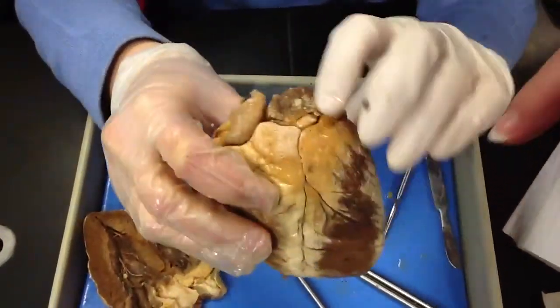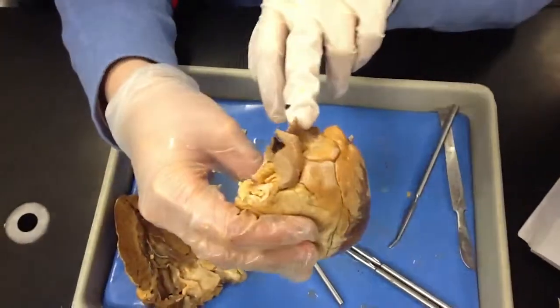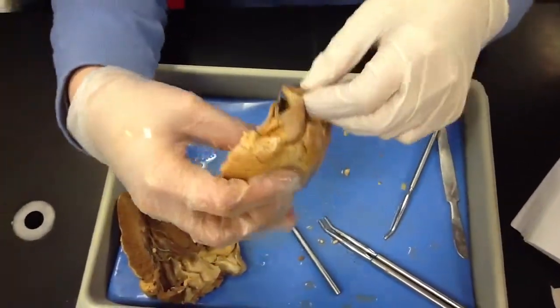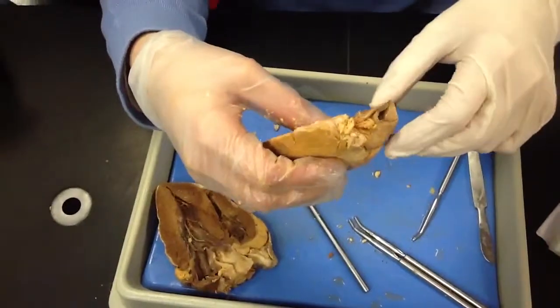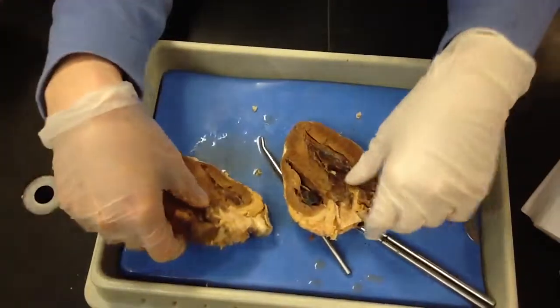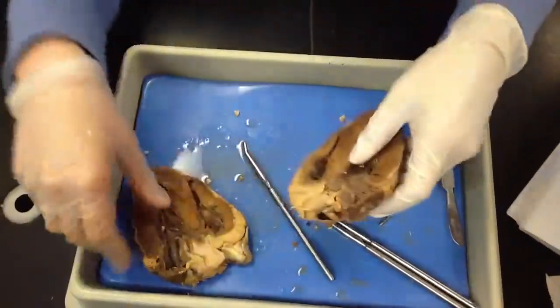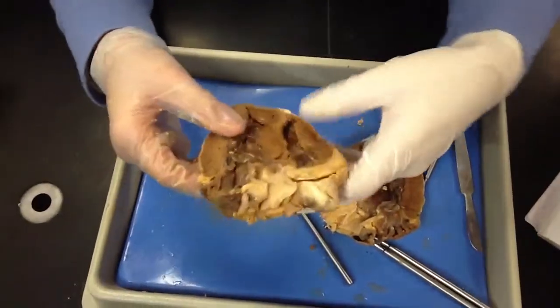Let's see here. No, that's the auricle right here. See? Auricle. What does the auricle do? It's the flap that covers, like a balloon that expands and contracts. Yeah, that's the auricle right there. Now, okay, let's see. It's just how you got it cut in half. Give me a second. Right, left.